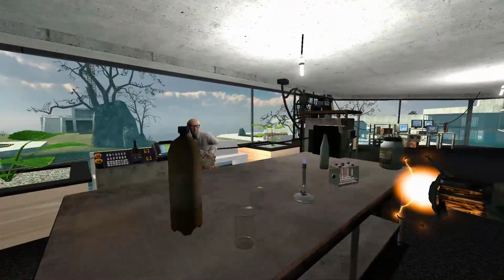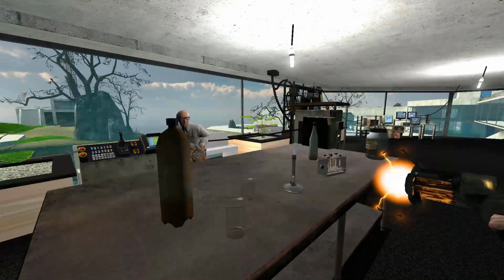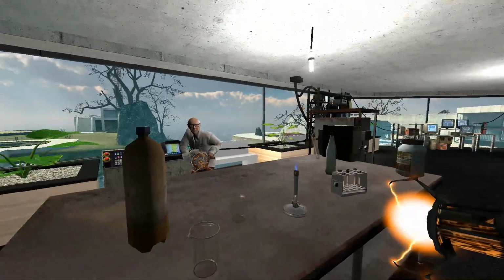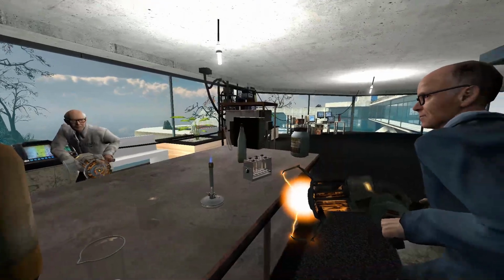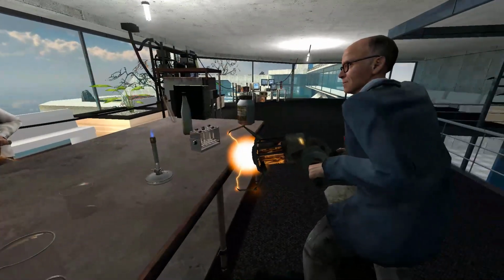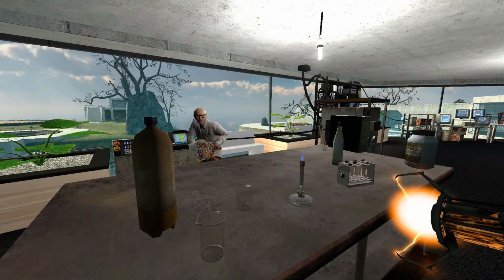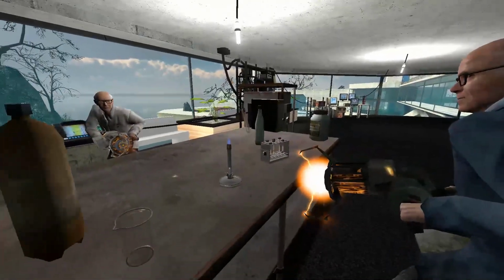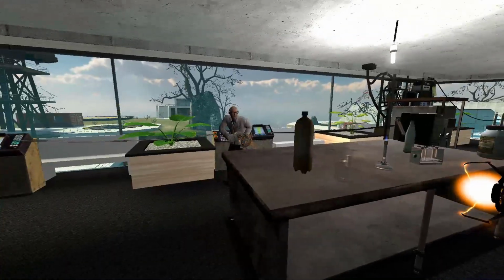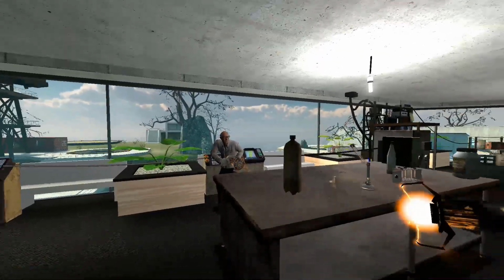So, here we're gonna show you how to heat up stuff safely. James is holding this test tube with a gravity gun, so he's not actually touching it, so he has no risk of burning himself. See, normally you won't have these, but since we're in a secret lab, we have them. So normally you just use tongs to pick them up. Just hold it over the fire and heat it up. So I should do this? Now, here's your chance to prove yourself. James, give him the test tube. Gabe, come in here.